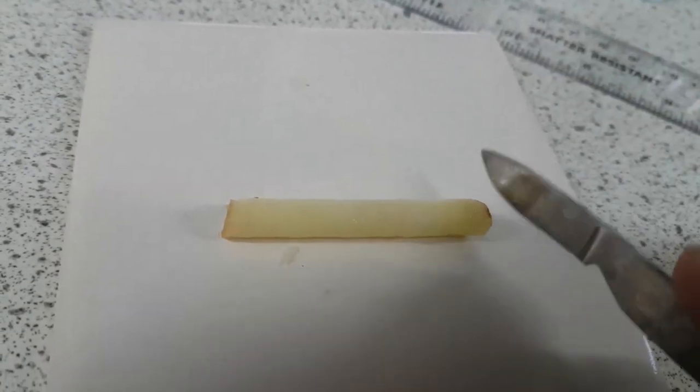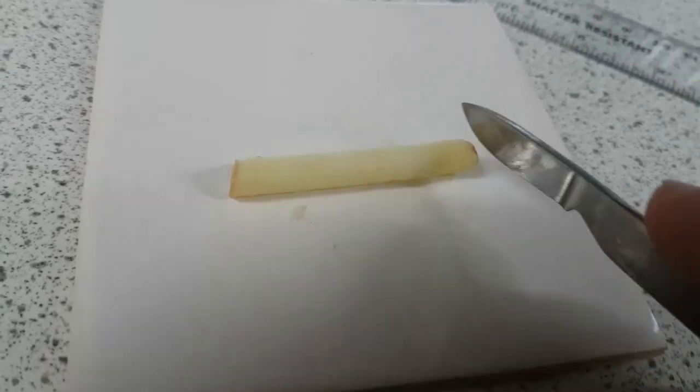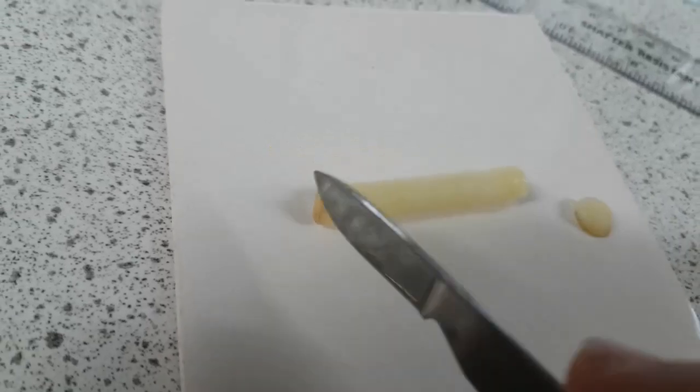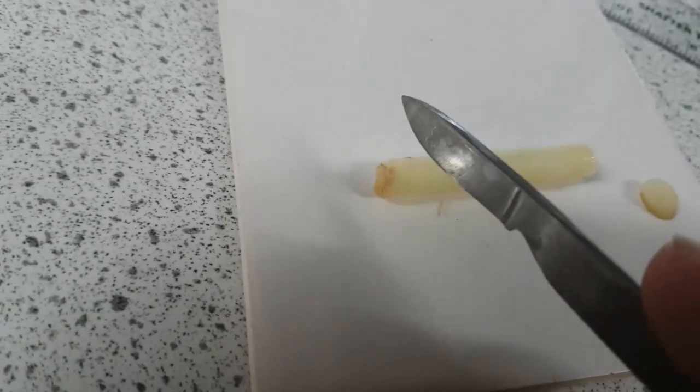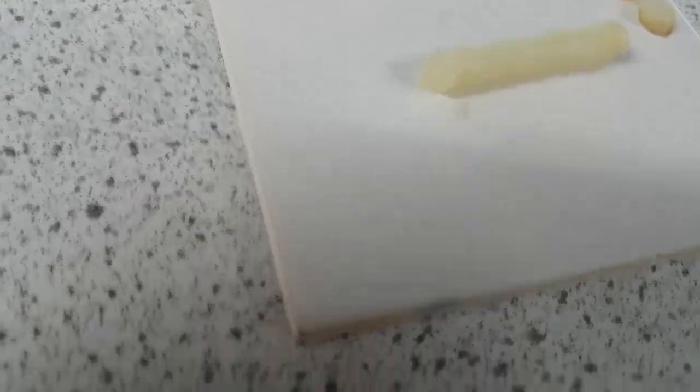Now guys, this is a scalpel. It is not a samurai knife or samurai sword or any other type of toy. Handle these carefully. They will be counted in and counted out and then counted back in.